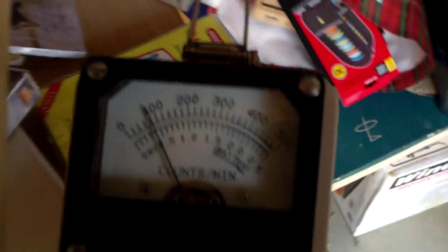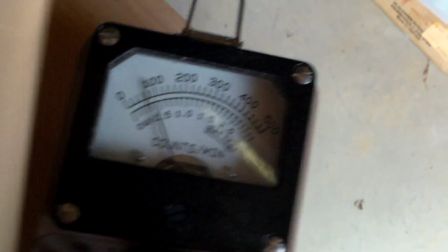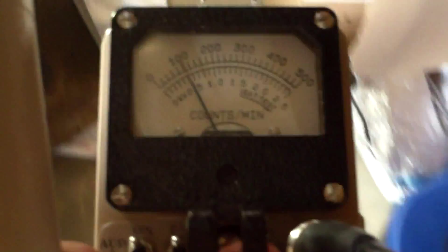So, it's times 100. So, instead of 2,000, we're now down to about looks like about 10,000... 8,000... Let's say about 9,000 counts per minute. And this area should be about 3. So, I'm going to kind of hold this like this so that you can see it.